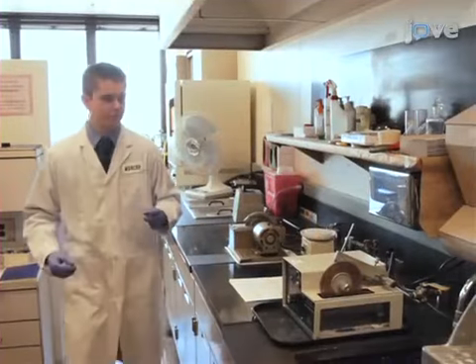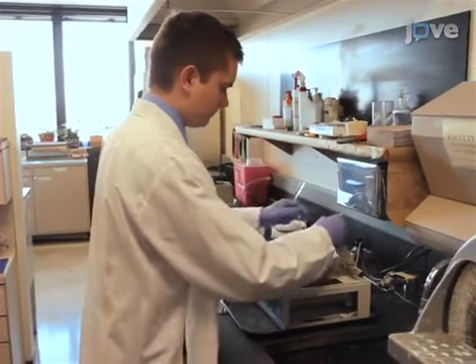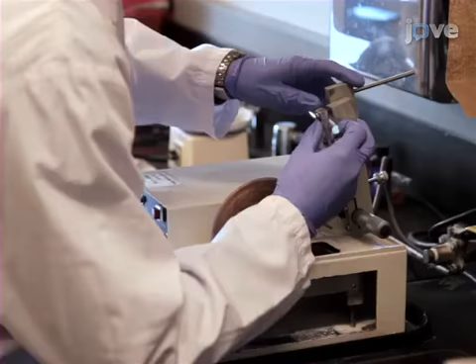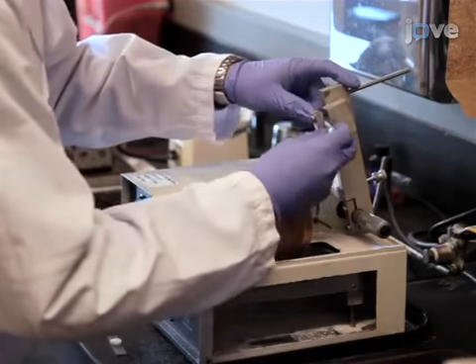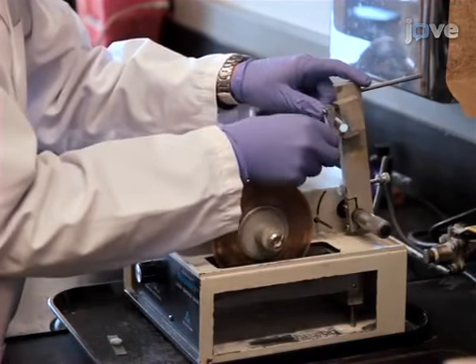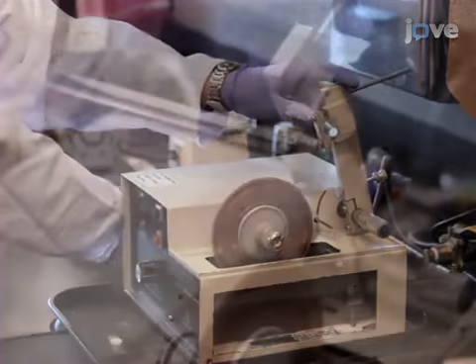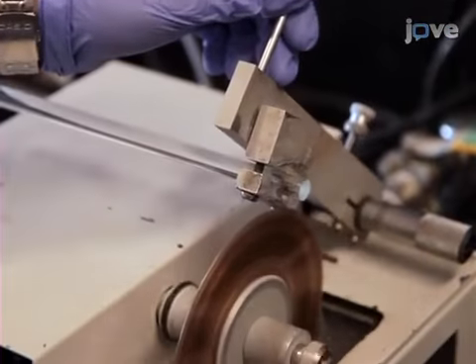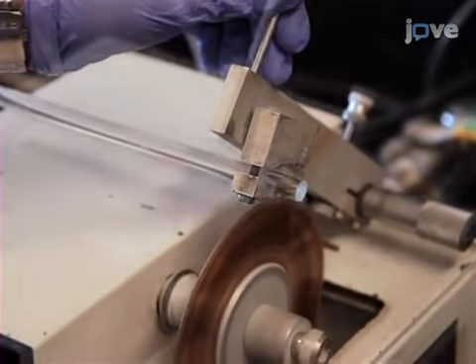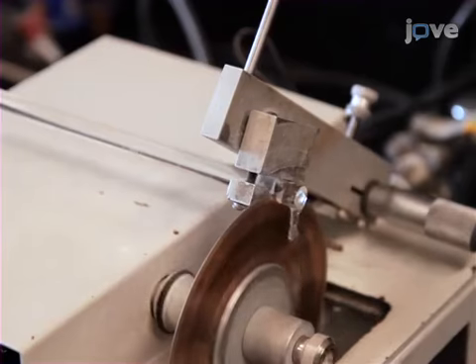As the first step, create tooth models. For silica glass tooth models, begin with a long cylindrical glass rod 10 millimeters in diameter. Use a low-speed diamond saw to cut the rod into 10 millimeter long cylinders.